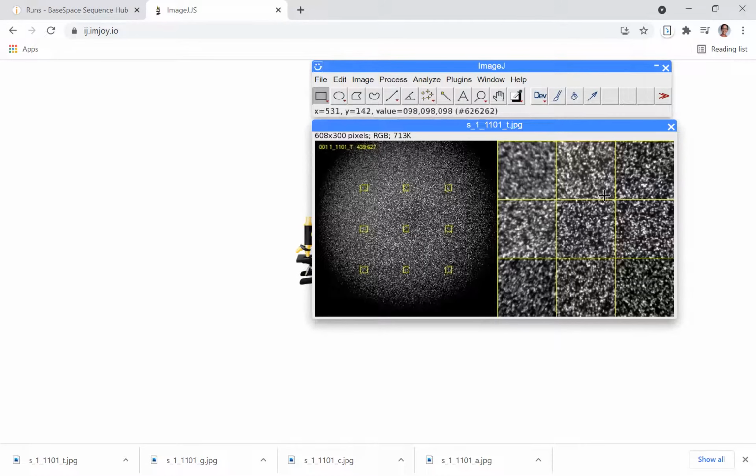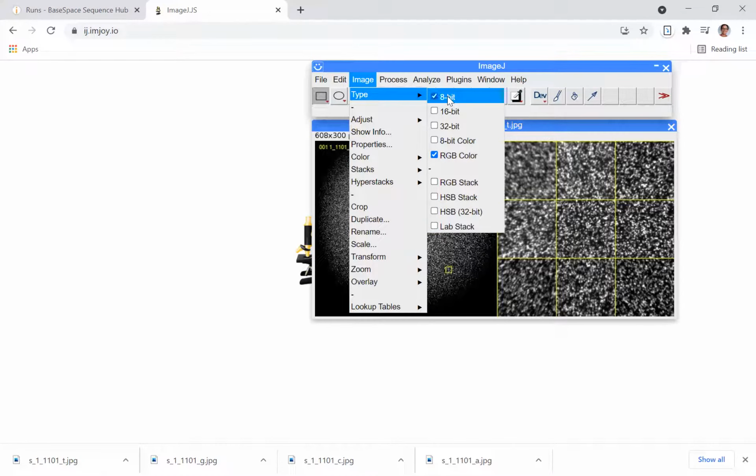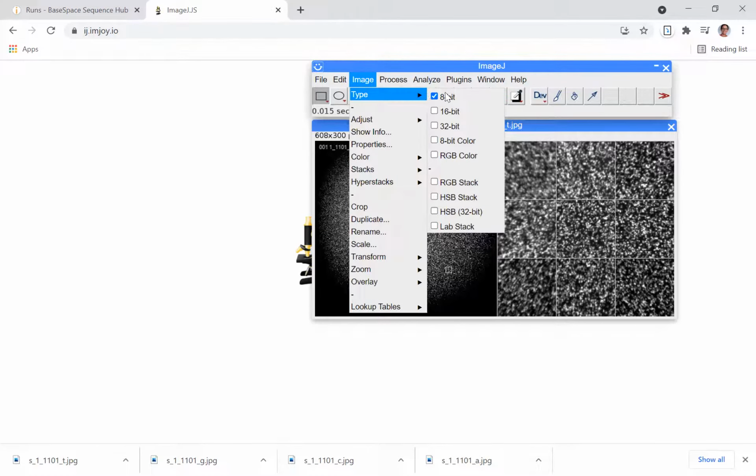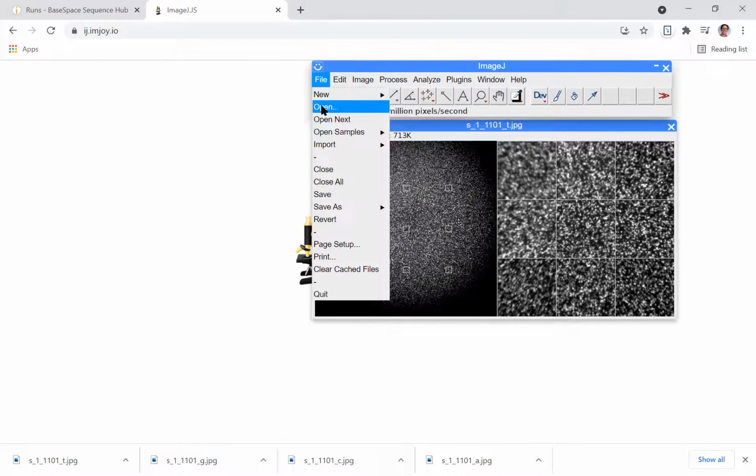And I'm going to use the colors that are on the Illumina graphs. So if I go to base space, I can see that each of the graphs, like for example, percent base per cycle, colors T black, G blue, C green, and A red. So those are the colors that I'm going to use to create this 4-color image. In order to do that, I want to start out by making every image black and white, get rid of those yellow lines, use a lookup table to apply a false color. Since T is black on the graphs, I'm just going to leave it black and white, convert the image back to RGB color, and then open up the next image.